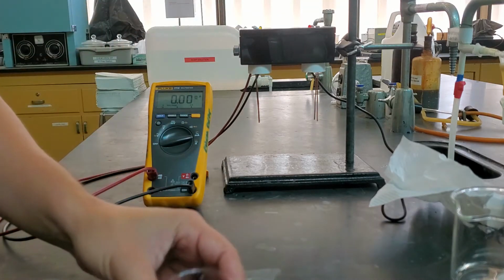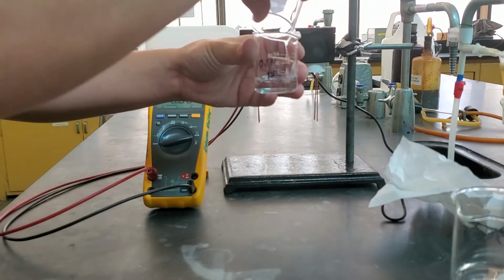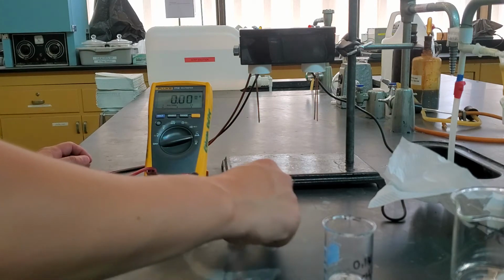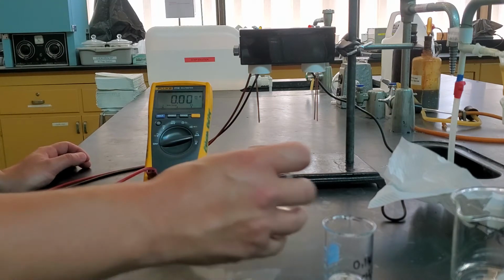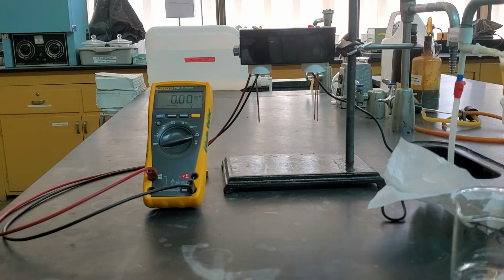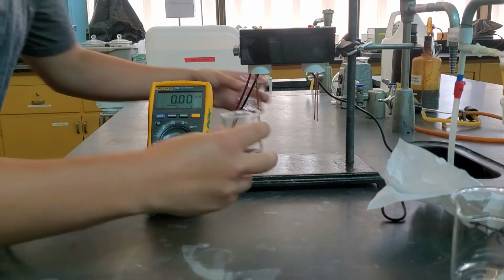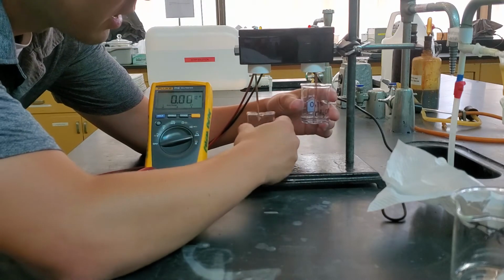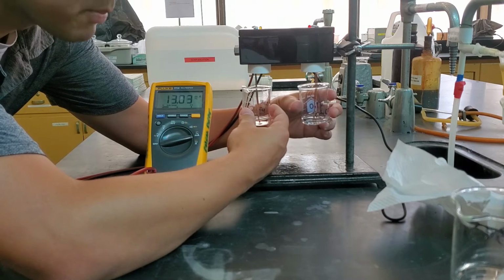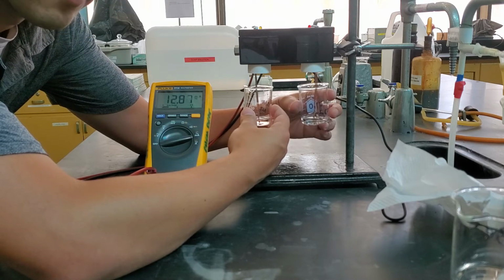I'm going ahead and I'm going to mix these 2 together. So our acetic acid is being mixed with our ammonia, NH3. Pouring in about half into each. We'll put them back on and we'll measure this mixture in parallel. So a much bigger difference than last time.